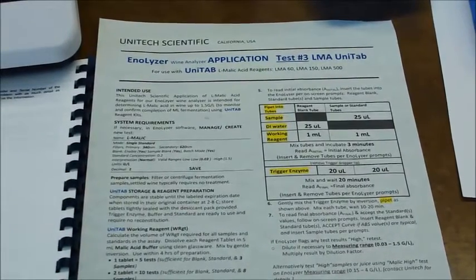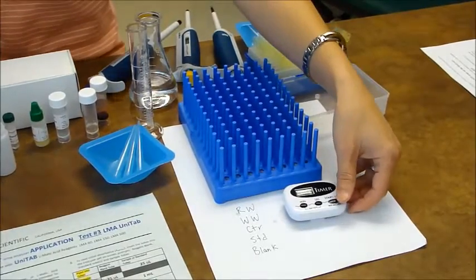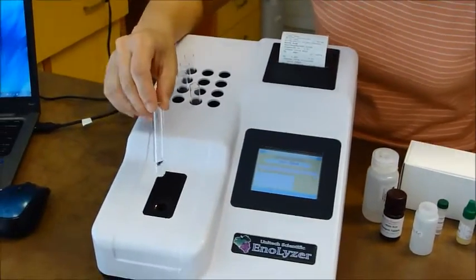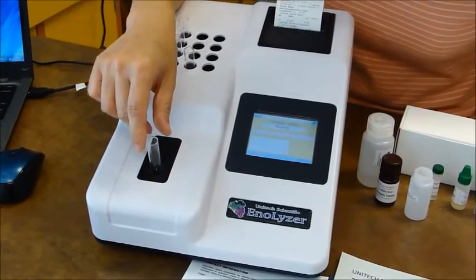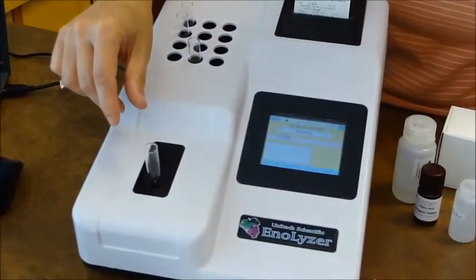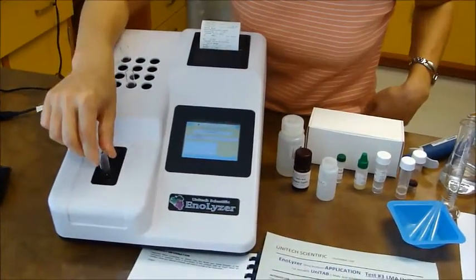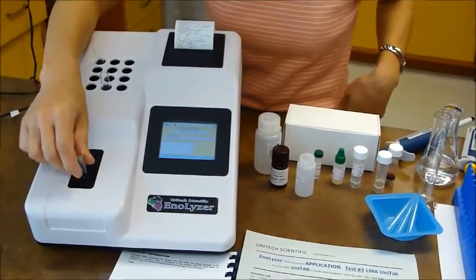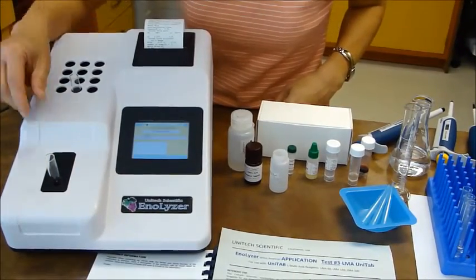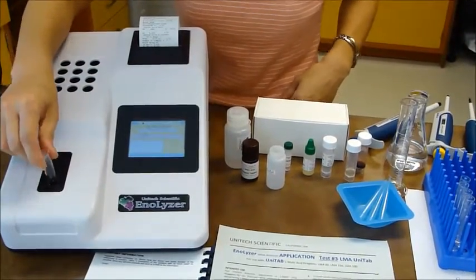The next step, when the timer is up, will be to start the reaction using the trigger enzyme. Now that the three-minute incubation is complete, we read the initial absorbance of each tube. The analyzer prompts us: first for the blank tube, then 'insert standard,' then sample one (our control), sample two (the white wine), and the third sample — removing each tube only when the analyzer signals to do so.